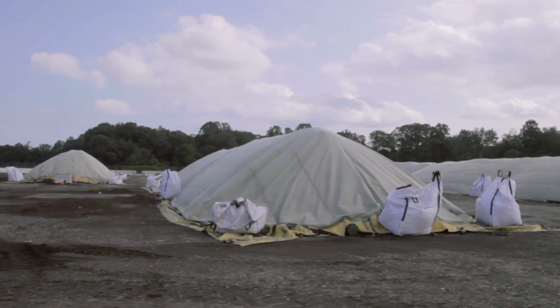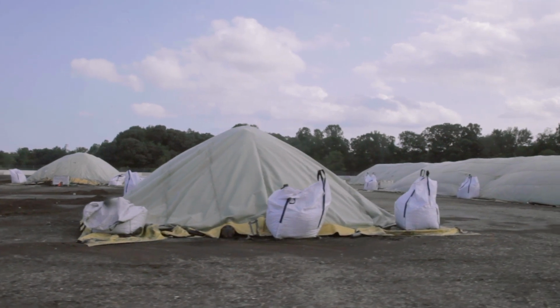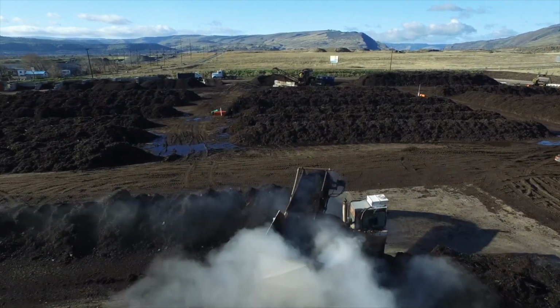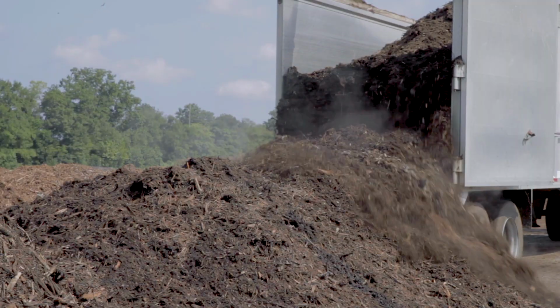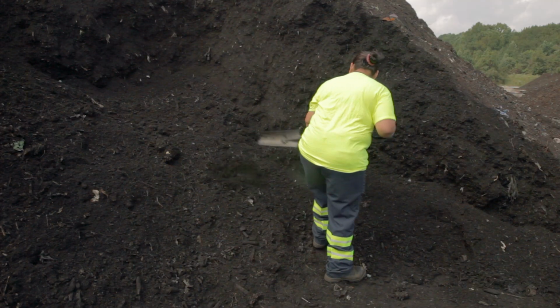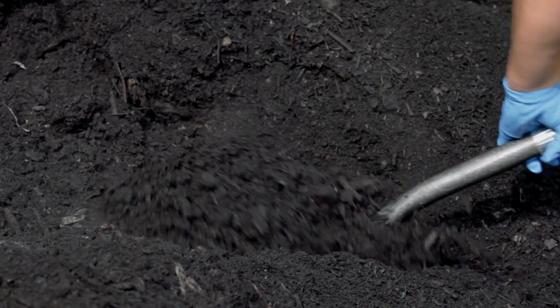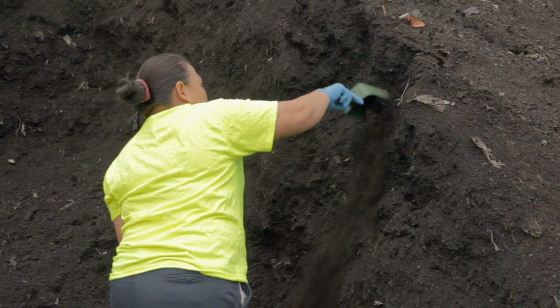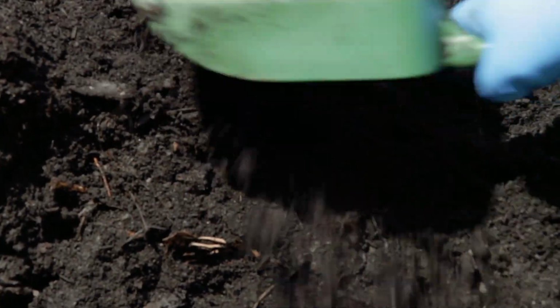When sampling for the pathogen content of compost, such as fecal coliform levels, special care must be taken in the preservation of the sample. Compost by nature is biologically active, and when analyzing for respirometry and pathogen content, it is important to slow down that biological activity immediately following sampling in order to provide accurate, defensible results.